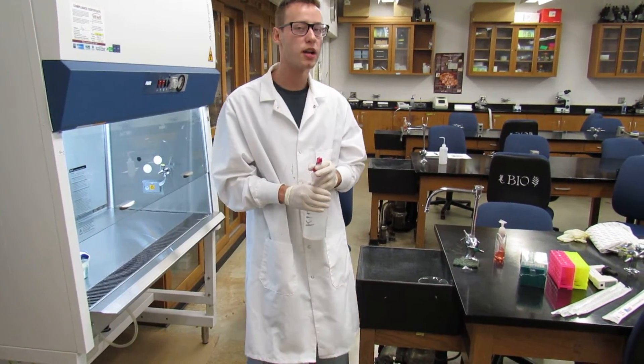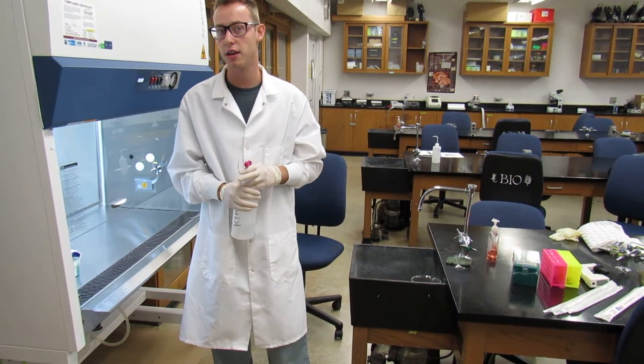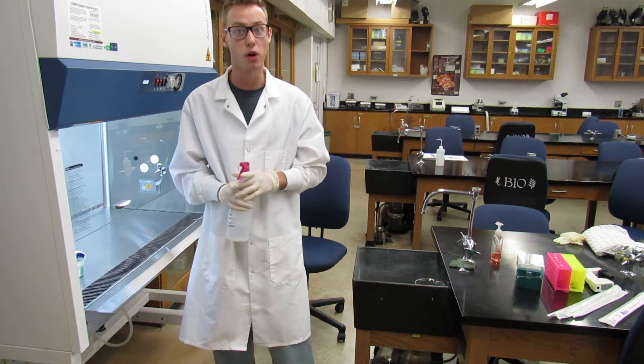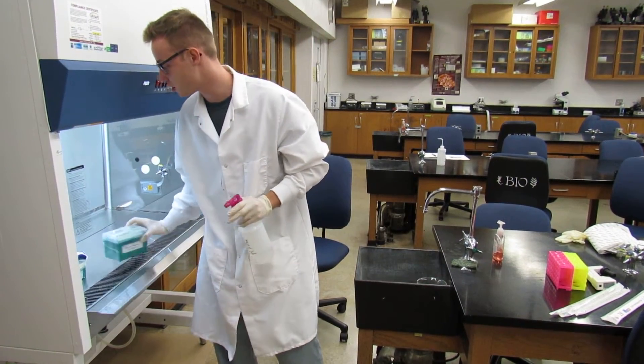It is important to note whenever you're working with your cells, you will never directly spray any of your samples with the ethanol, but every fomite that you put inside there will get sprayed with ethanol, minus the serological pipettes, which you'll see in just a moment.